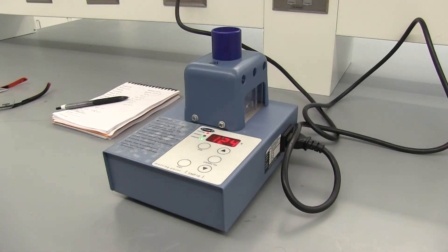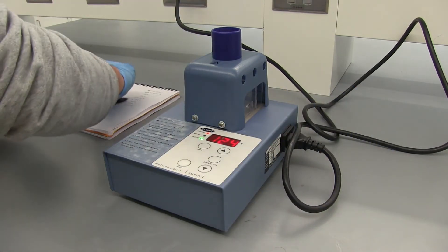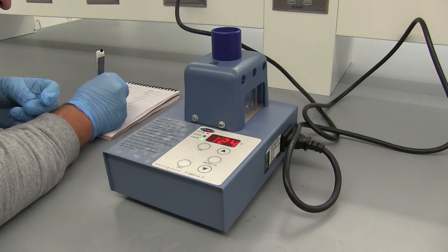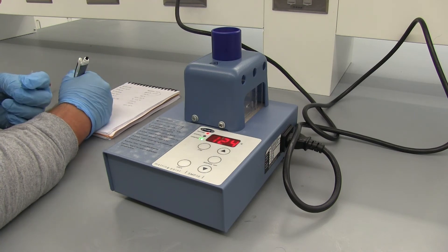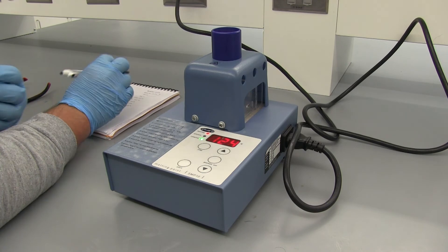Alright so our mixed melting point was 122 to 124 again so that does confirm it is benzoic acid but we'll double check that with our benzamide and we'll go ahead and get a mixed melting point of that.